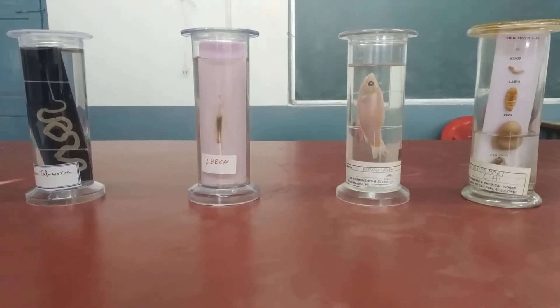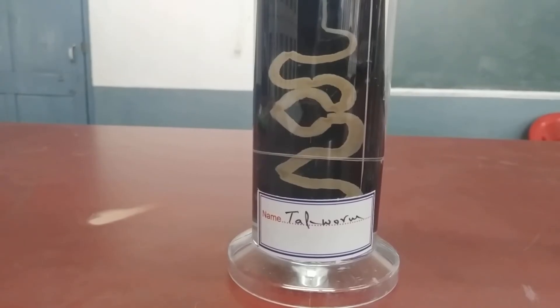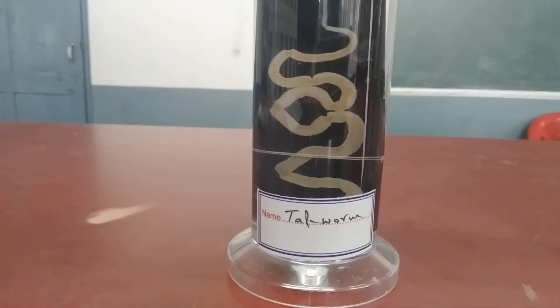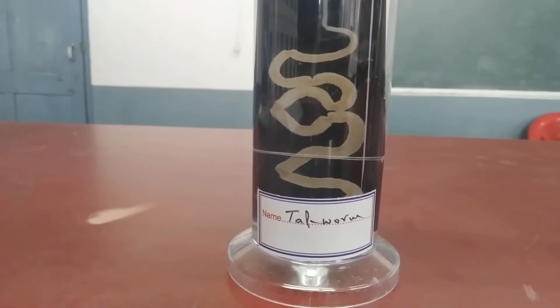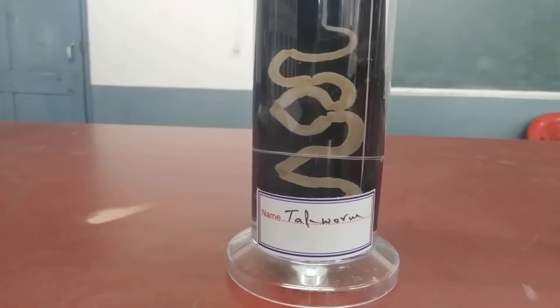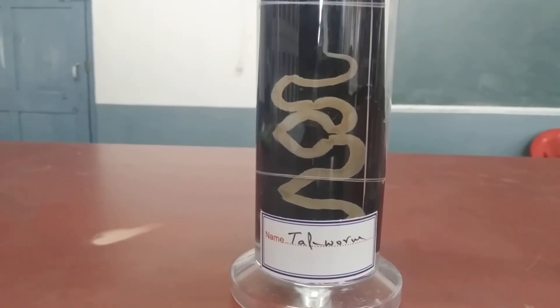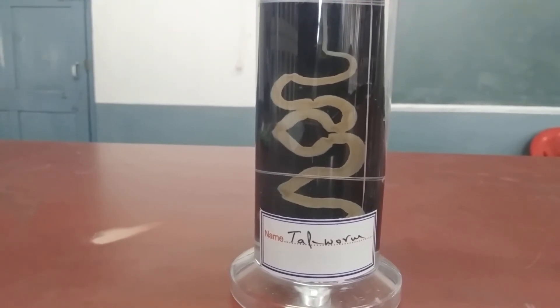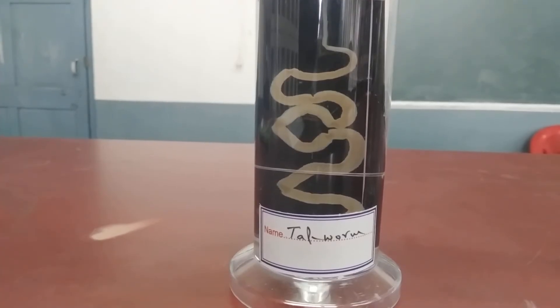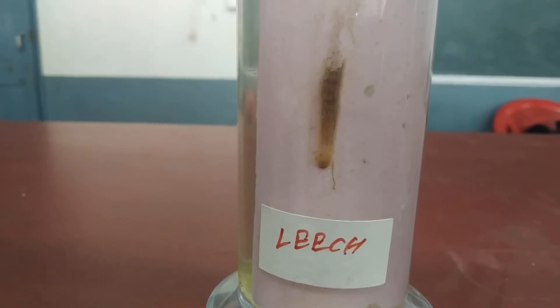You also need to write the correct scientific name. The tapeworm is a parasite — it is a long but flattened structure. At the top you'll find a swollen structure called the head, called the scolex. If you look at the structure properly, you'll find many segments; these segments are called proglottids.